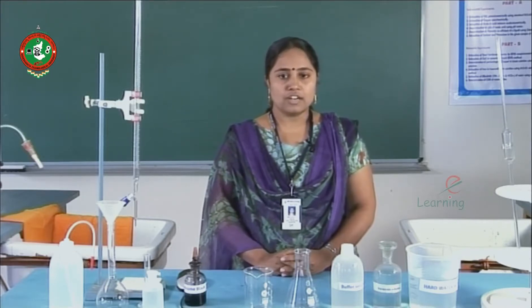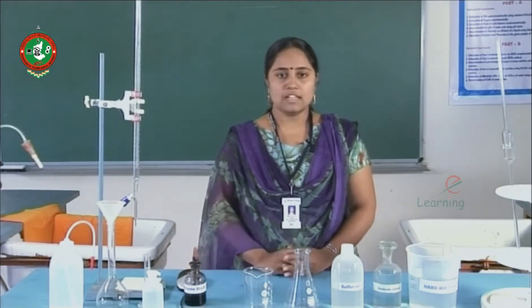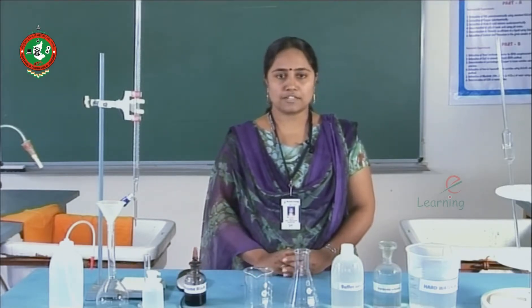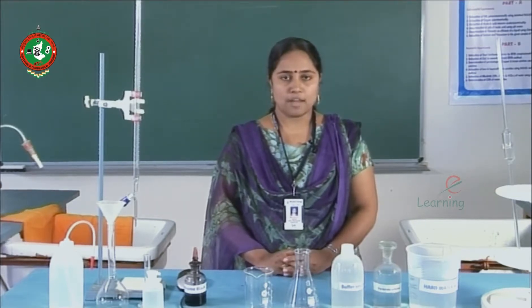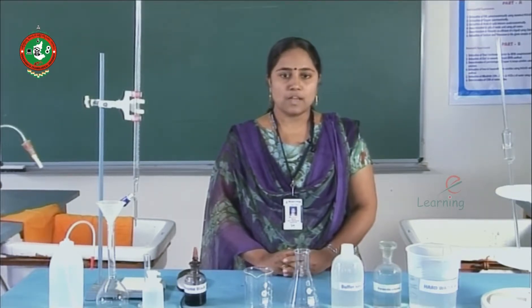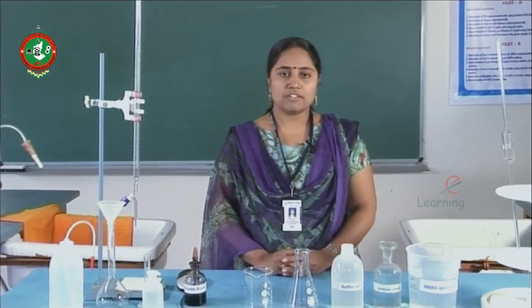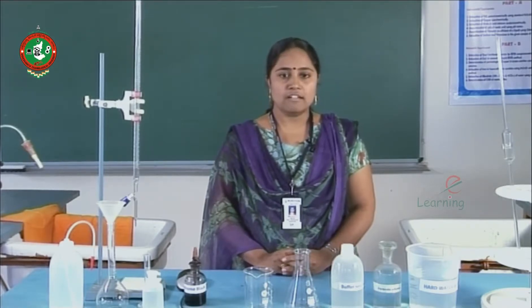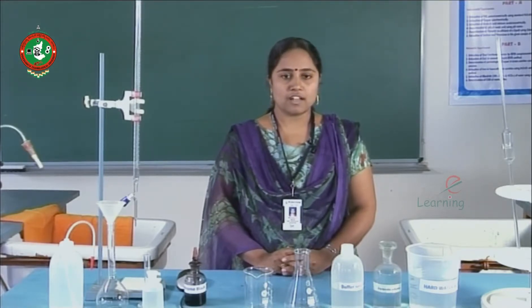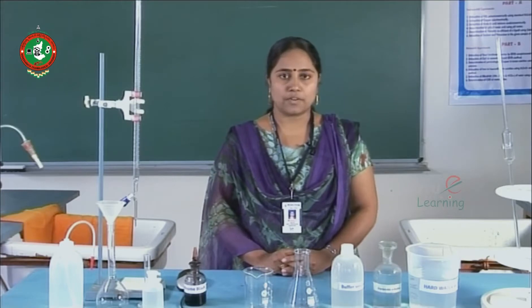While transferring the solution, do not blow air through the pipette. Let us see how the conical flask has to be washed. Wash the conical flask thoroughly with tap water, then rinse it once with a small quantity of deionized water. Do not rinse it with any of the solution. After every trial, reject the contents of the conical flask to the sink, wash thoroughly with tap water, and rinse with a small quantity of deionized water.